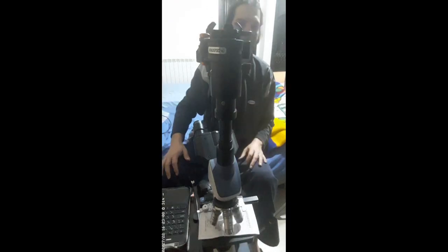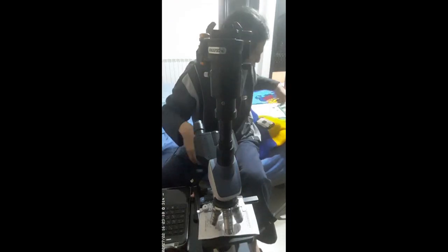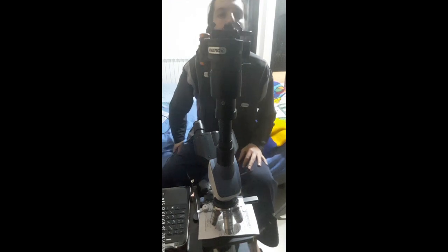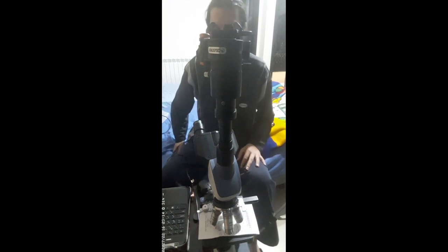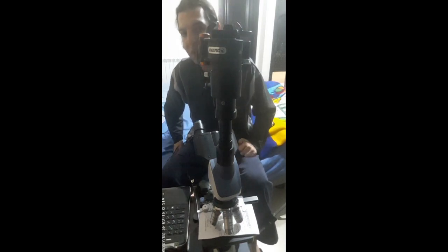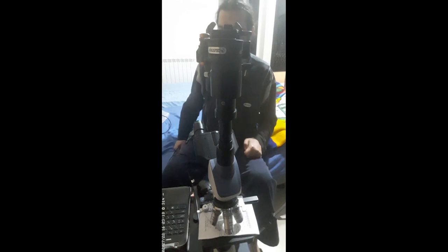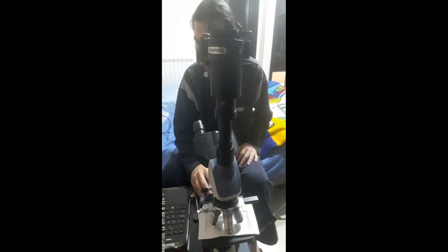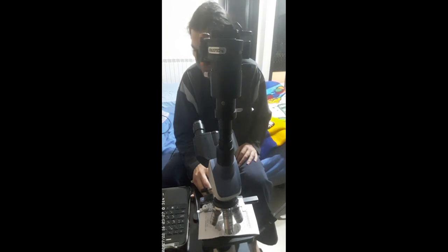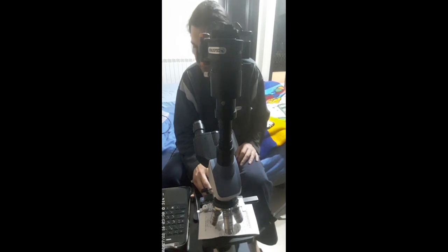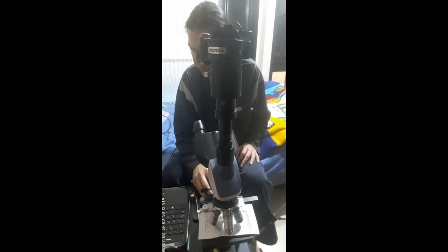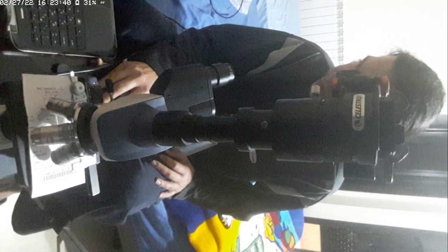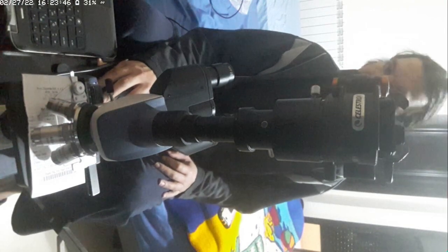Okay, now we're done. Now we have to take a picture. Let's first, I want to do this first by rotating the whole view so I can get a bigger scene. I'm using the eyepiece, so I'm going to make it like this, and also going to revolve the camera.